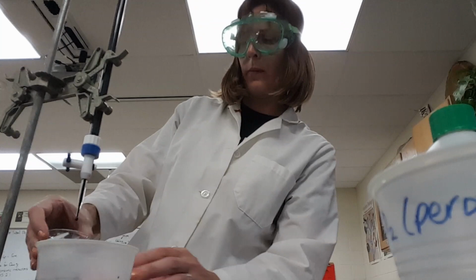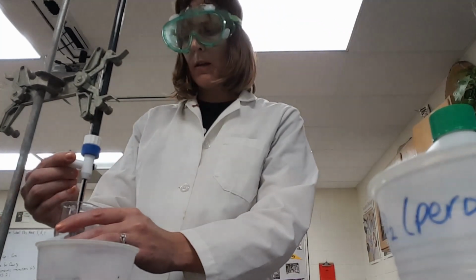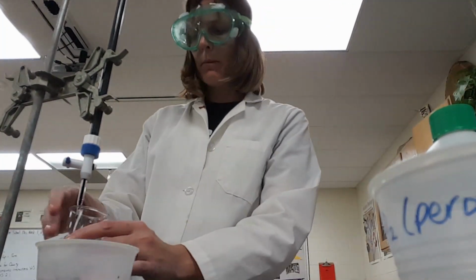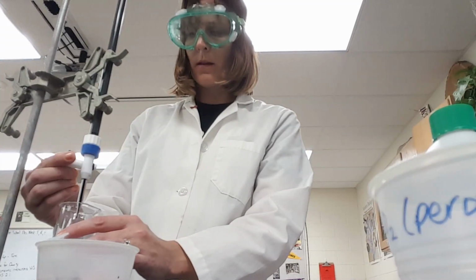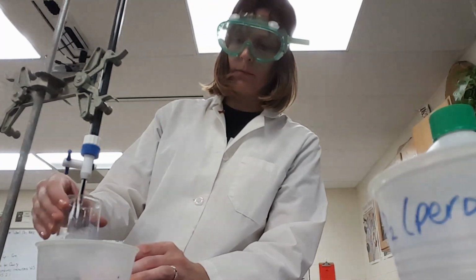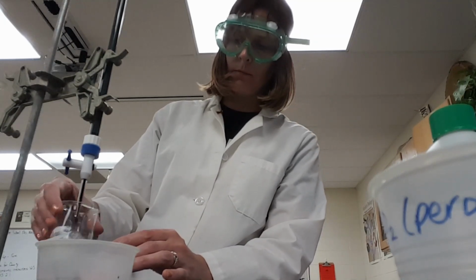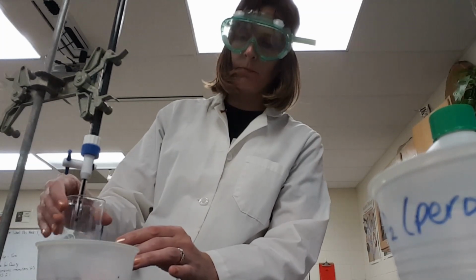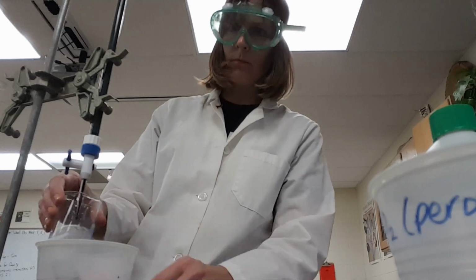Whoa, stop. Some of it was getting hung up in the foam on the top, and I wanted to make sure that that didn't end up not being mixed in and just that little bit shooting us past the end point. Ooh, getting closer now. I can't see.